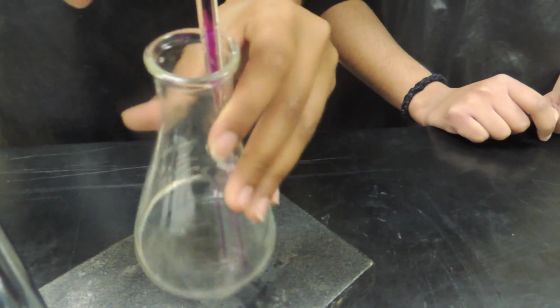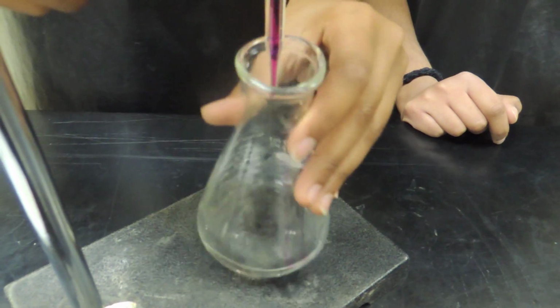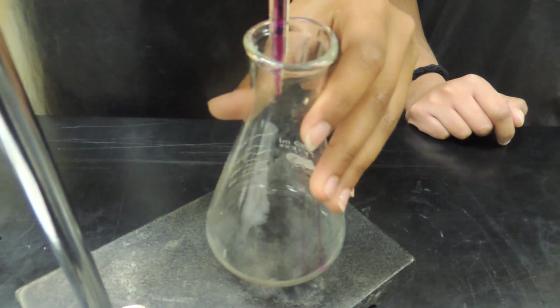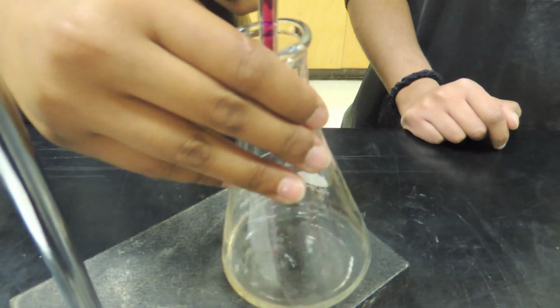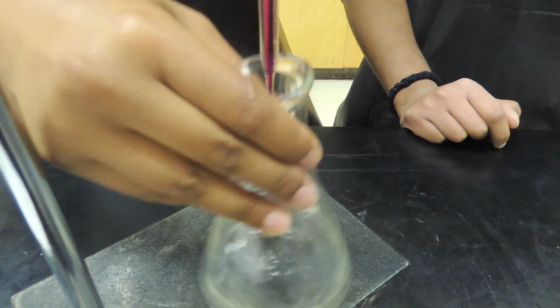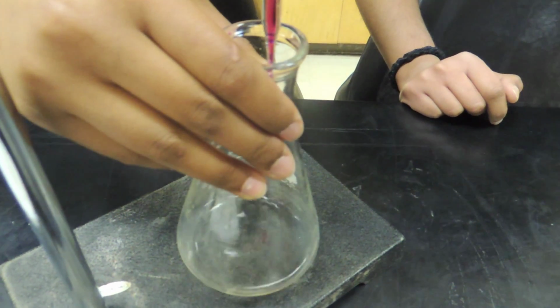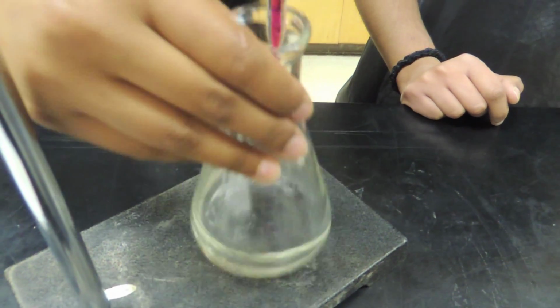Place the Erlenmeyer flask under the burette and open up the stopcock to begin the titration. Slow down the flow of the potassium permanganate solution when the purple color begins to linger longer in solution. Keep shaking the Erlenmeyer flask throughout the titration. Note that the indicator does not change color at exactly the equivalence point. The darker the indicator color gets, the further the titration is past the equivalence point.